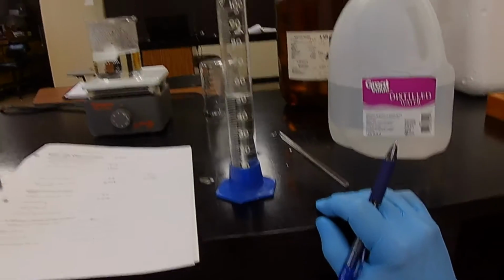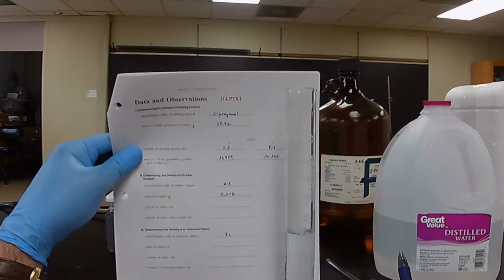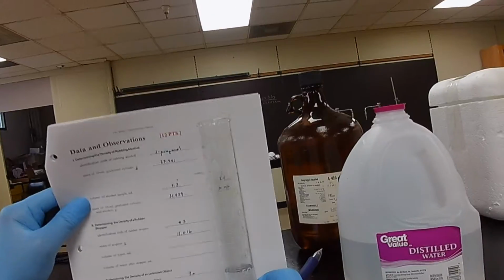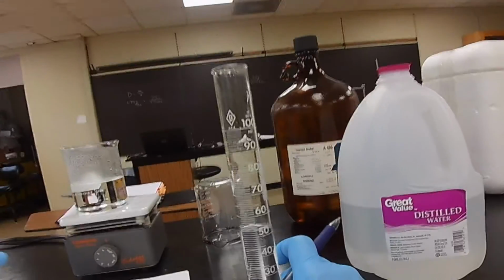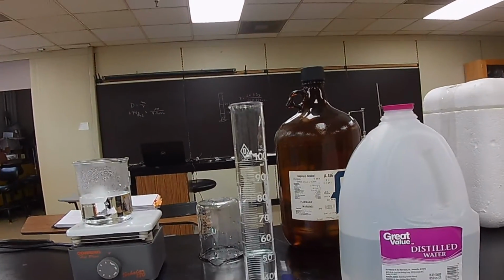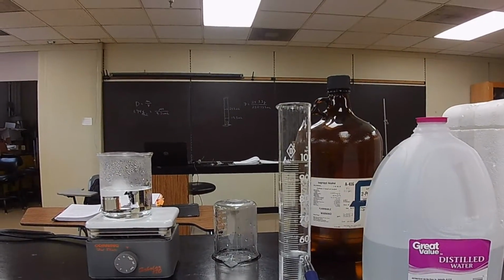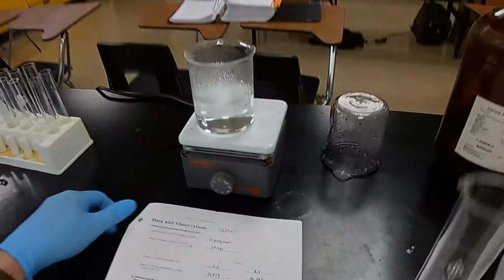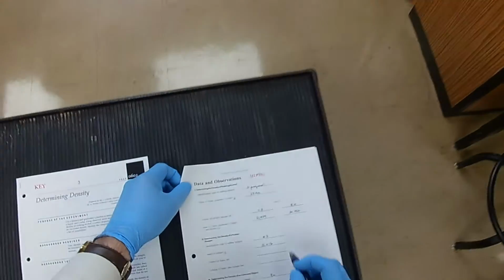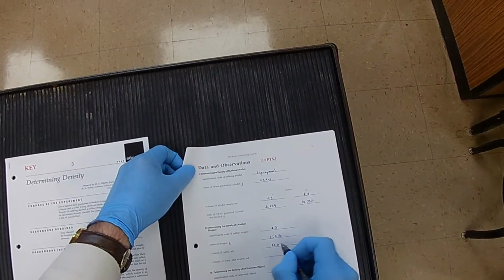That's the volume of the water on your data sheet. So the volume of the water at eye level is, let's see, it's kind of hard to see those lines, isn't it? Black is better. Let's use black background. Okay, eye level. That's about, let's see, no, exactly. 50, 1, 2, actually 52.0. 52.0 milliliters is the volume of water. 52.0 milliliters.